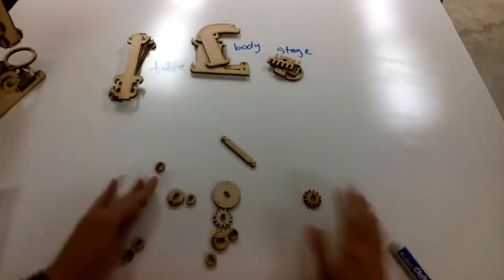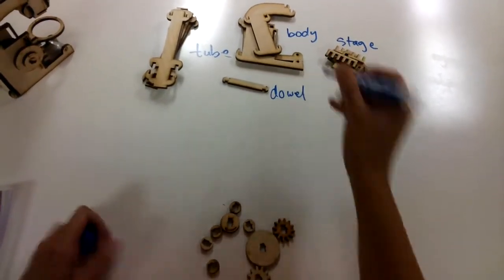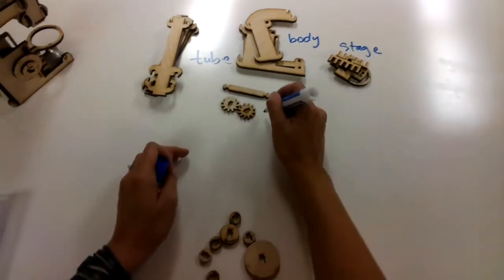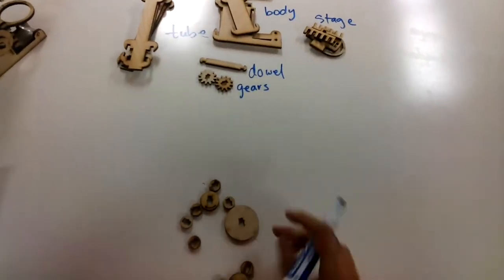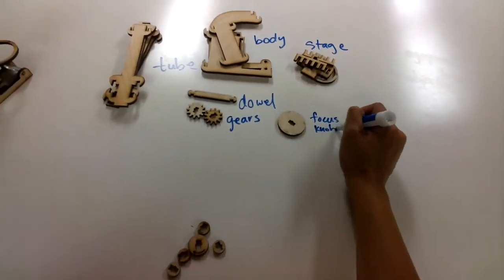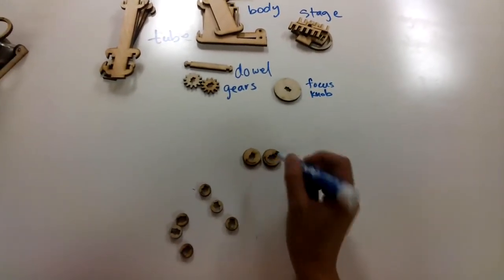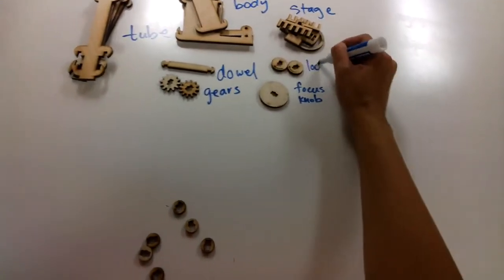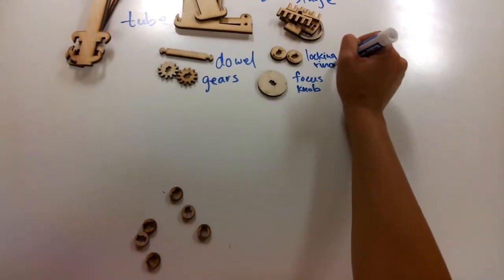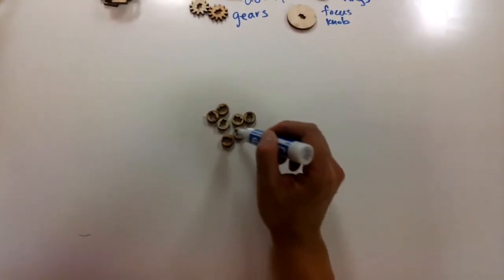And then you have all these little tiny pieces that we're going to figure out. So you have 1 long skinny piece, that's the dowel. You should have 2 gears. And you should have 1 big circle, that's your focus knob. And then you should have 2 kind of medium-sized circles with little arrows on them. These are your locking rings. And then you should have 7 little circles with little rectangular holes with little notches in them. These are your spacers.